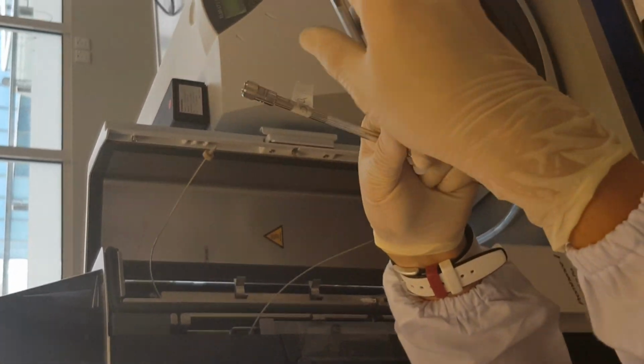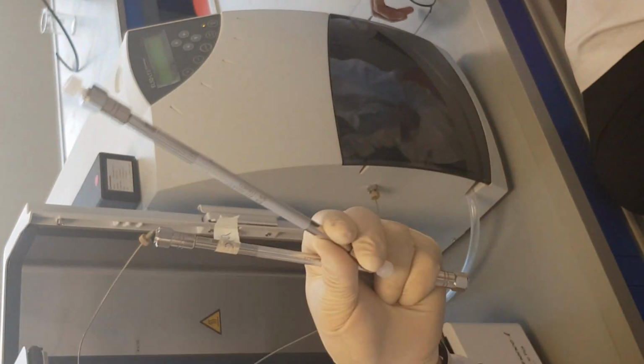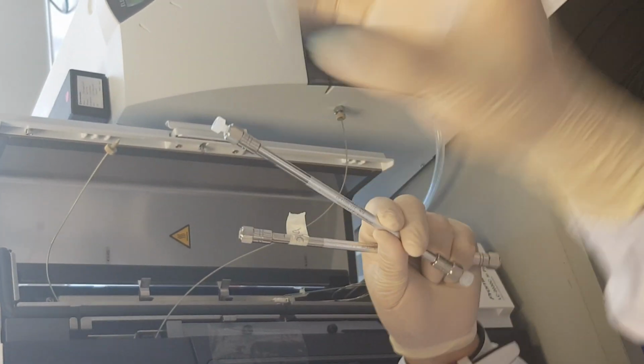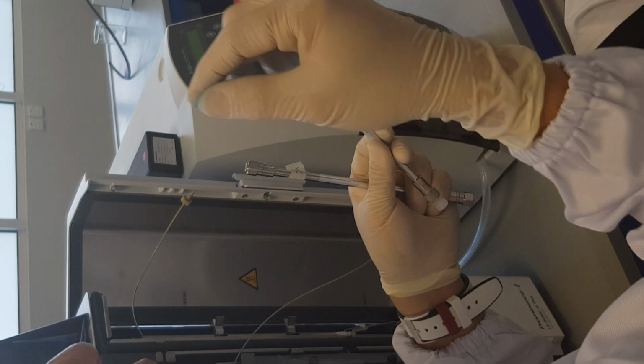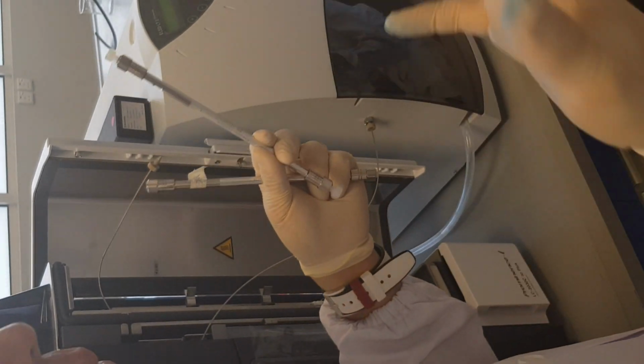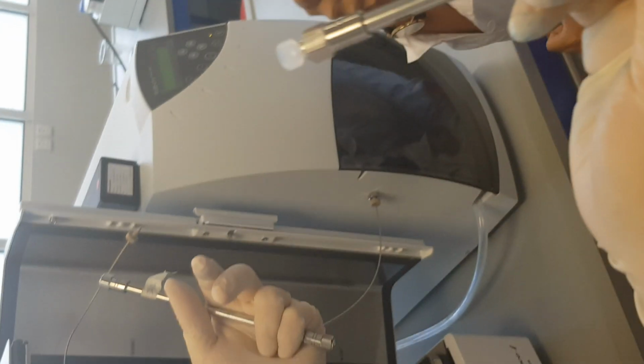Same thing over here. Initially, all the stationary phase is very compacted. But if you drop it, it will get loosened and it won't have the compactness inside anymore. So it will affect your analysis. Loose air gaps go in, and a lot of complications will take place. So this column cannot be used later.